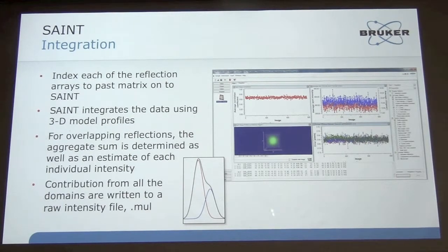And so here what you see is sort of a partial overlap, where the blue is actually one spot, and then the red is another spot, and then the black is what it actually looks like on the detector, or the aggregate. And so that's what you're trying to separate. So what SAINT does is it produces single reflections for those that are non-composite, and then for the composite reflections, it'll partition and come up with an intensity estimate of each domain contribution, and then an aggregate sum. And it passes that on for scaling.